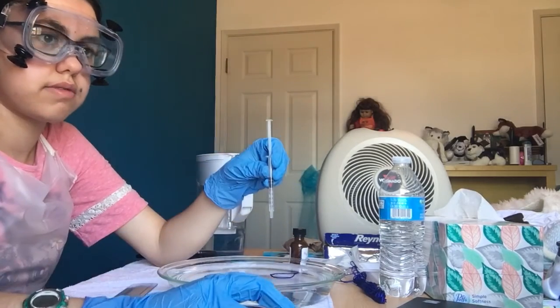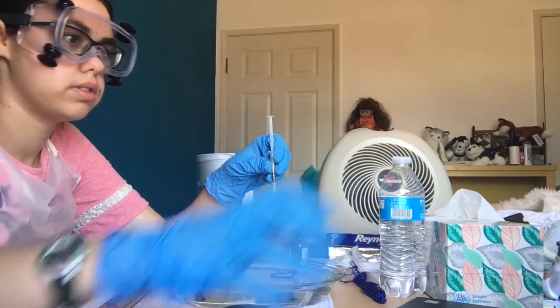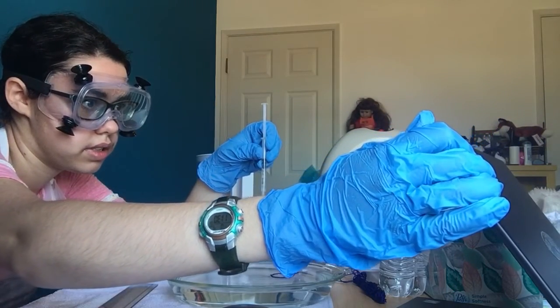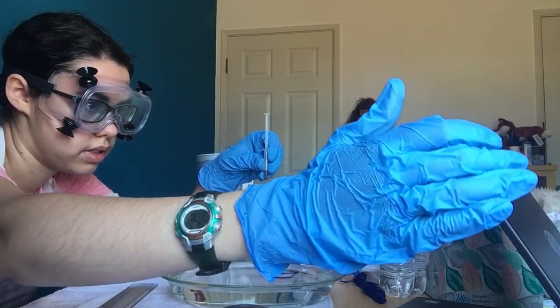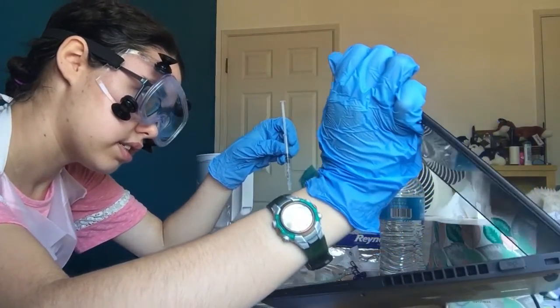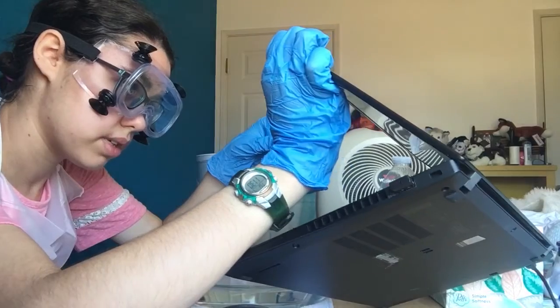So I can show you with my camera. That's what I mean. Oh yeah, you still need more stearic acid in there. Yeah, because it is circle-like, but it's also teardropped.